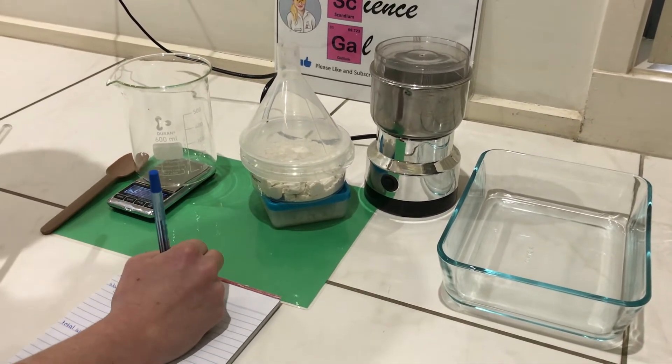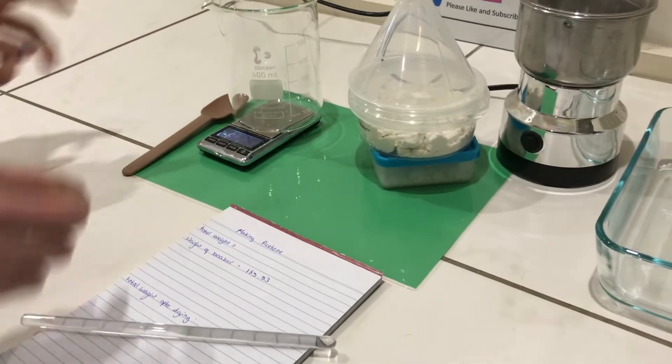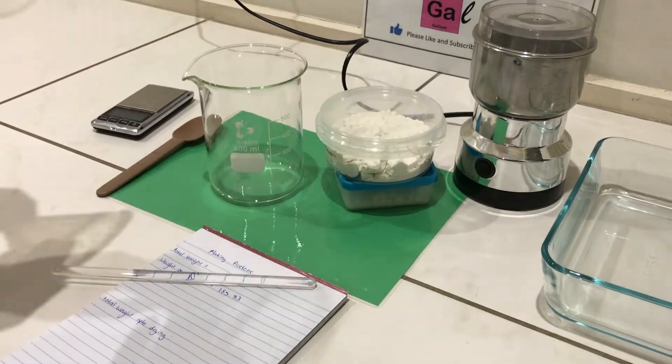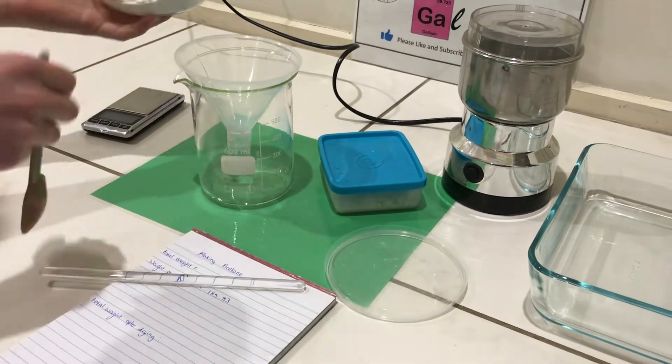First, I weighed the beaker, then I will subtract that from the result. Once again, this video has taken a while to make, because I've been busy with school, and I also got COVID, so I couldn't film for a while.